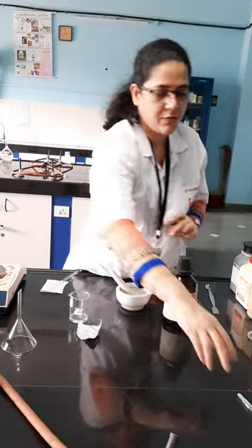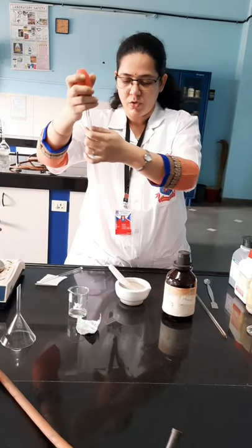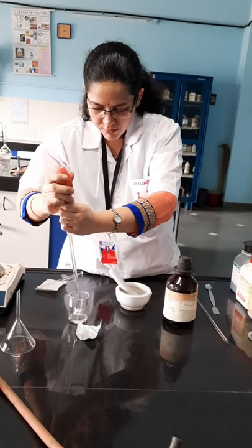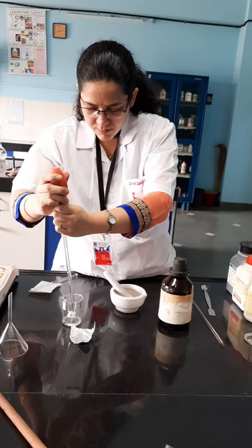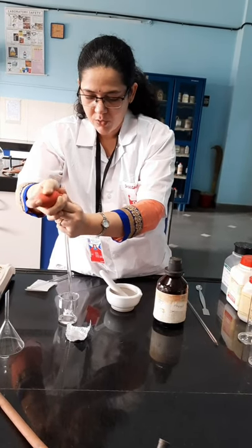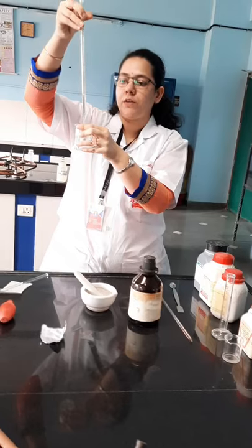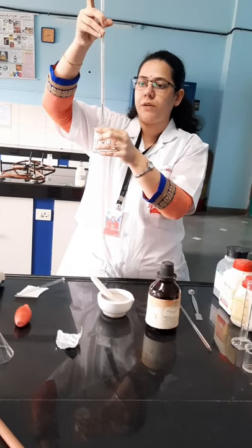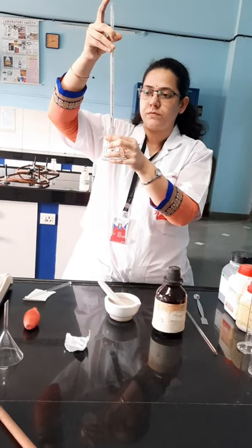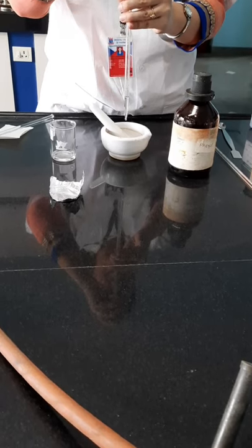I have to add 1 ml of glycerin, for which I will use a large pipette. The density of glycerin is higher than that of water, so it is always better to use a large volume pipette to transfer glycerin — it is viscous in nature. Use a 10 ml or 5 ml pipette; even without holding the tip, it takes a long time to flow out. I am now adding the glycerin to the earlier prepared suspension.